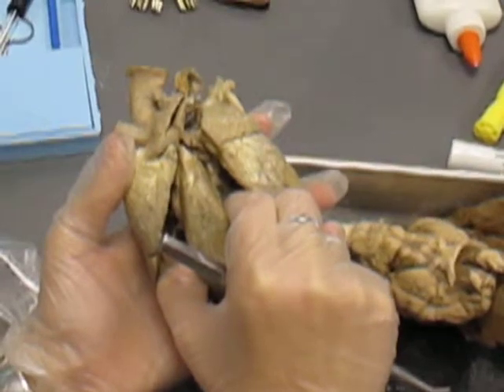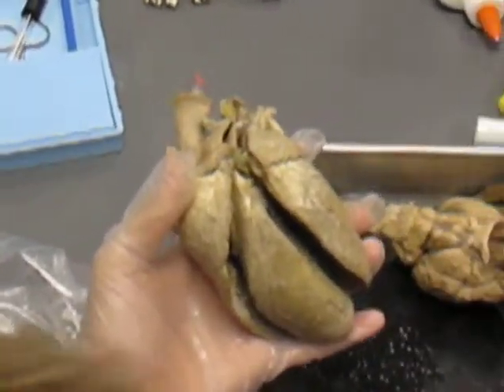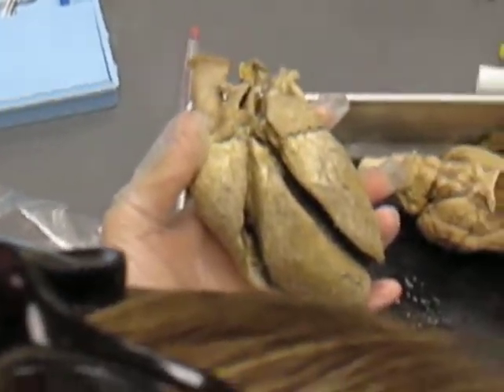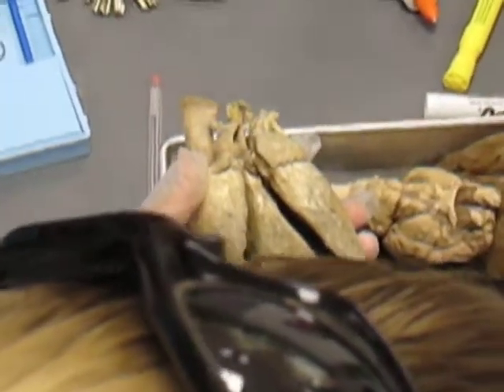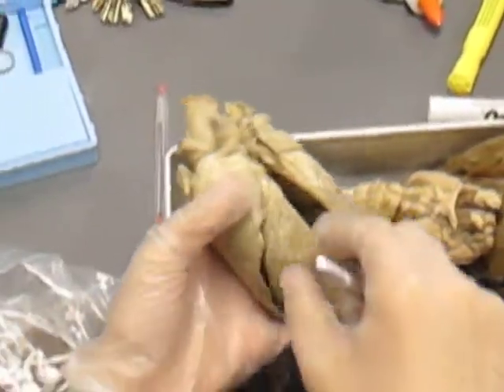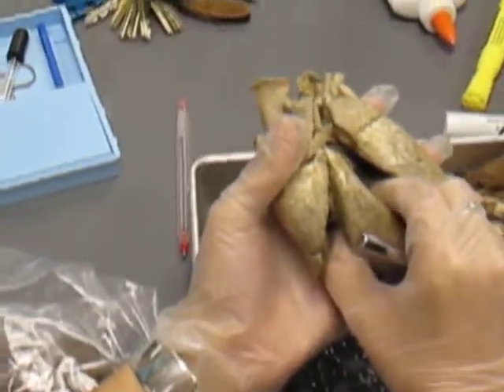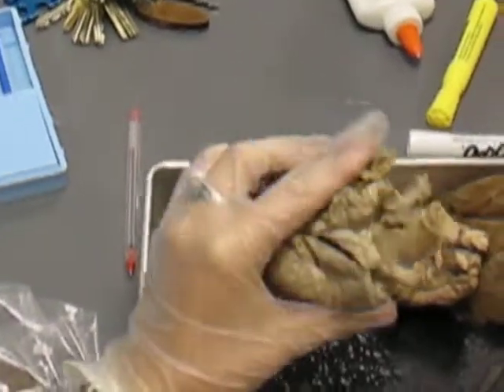Go back to the, flip that page this way. This one. Interventricular septum is this part that separates your 2 sides of your heart. Okay? Is that it? That's it for the heart.